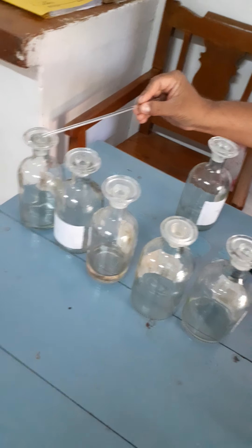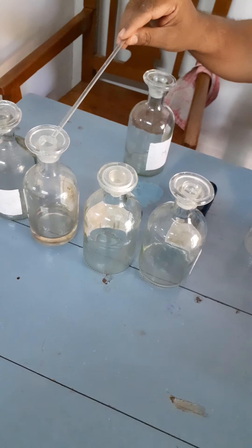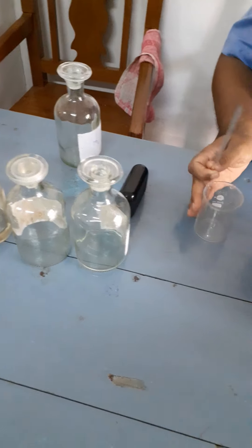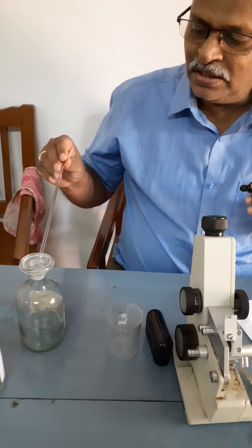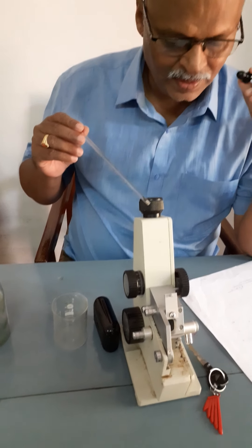Liquid A is pure benzene. Liquid B is pure CCl4. Liquid mixture M1 contains 30% A. M2 contains 40% A. M3 contains 60% A. Additionally, we have liquid mixture C, which contains A and B, but the percentage composition of A is unknown. Our aim is to determine the percentage of A in this unknown liquid mixture using the refractometer and a graph.